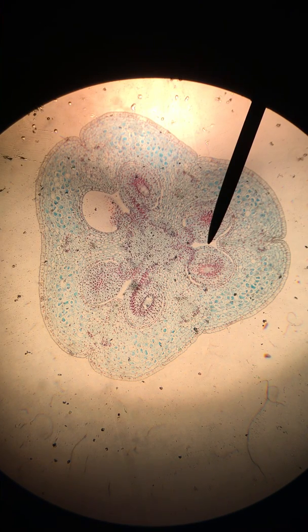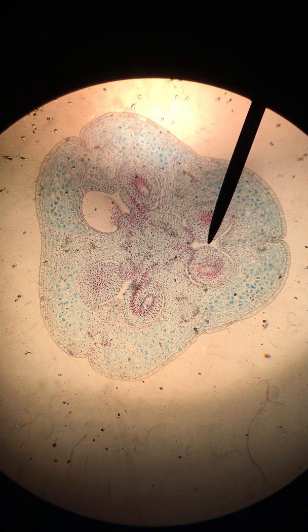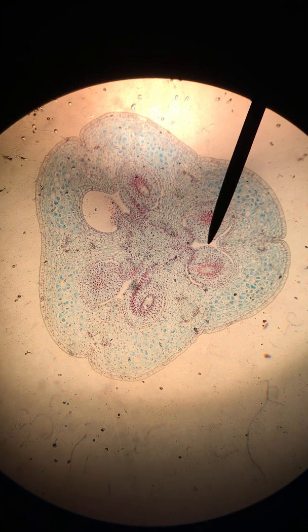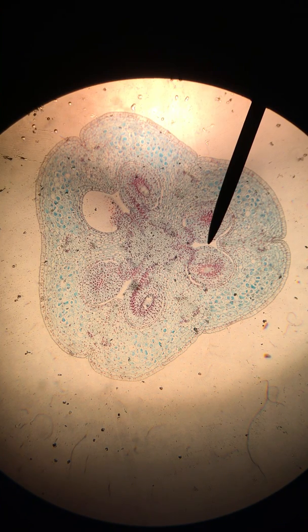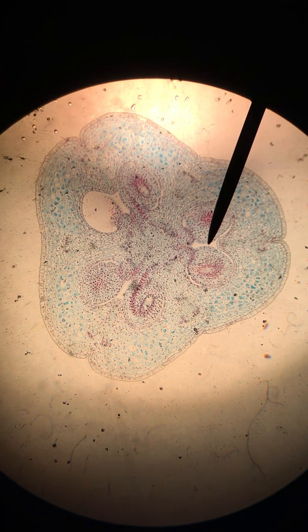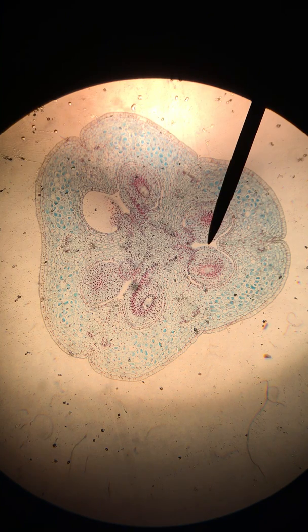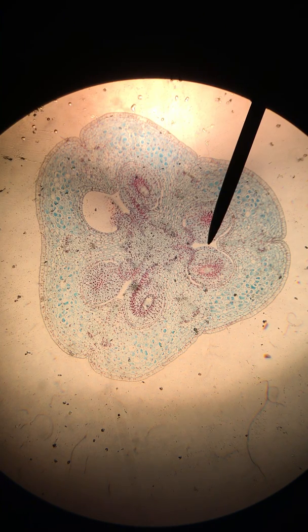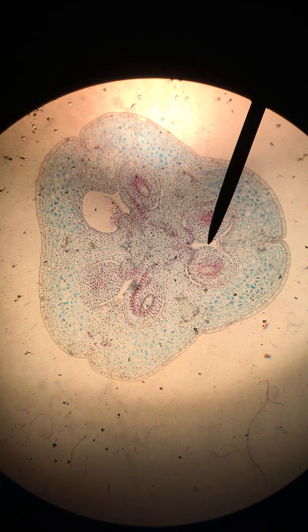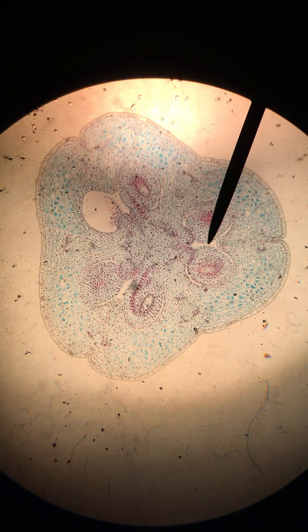This is slide 8, the mature embryo sac. The first thing we are asked to identify on this slide is the ovary locule. The locule is just a space that surrounds each of the ovules.